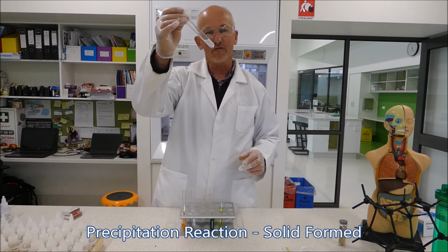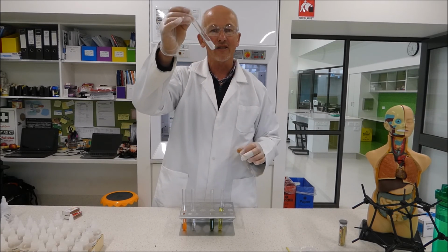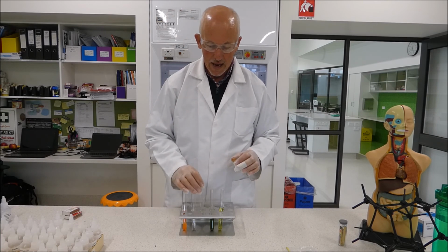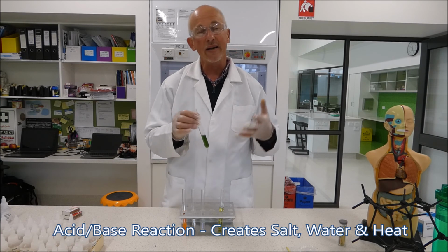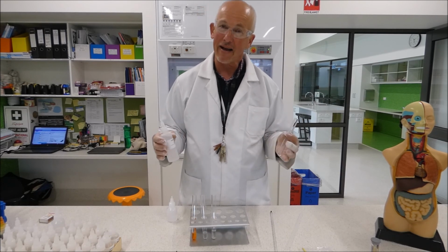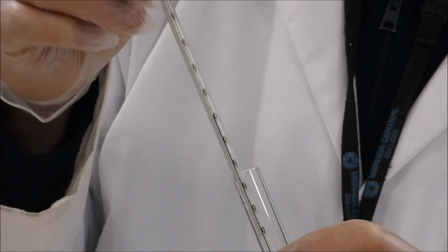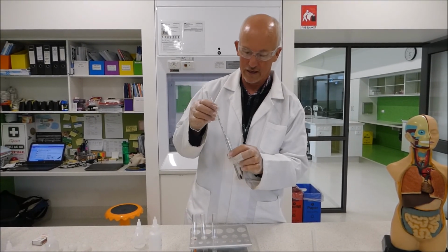Now, when we first did the reaction, it actually turned pure white, but you can see now that solid has dropped to the bottom of the test tube, and we've got little pieces of solid in there. And the last one was a neutralization reaction, or an acid-base reaction, where we added acid to base, and we observed a temperature change or an energy release, so you get the temperature going up or down. That's what we call an exothermic reaction. An exothermic reaction shows that the chemicals have reacted. In this case, it's reacting to form salt, sodium chloride, and water.